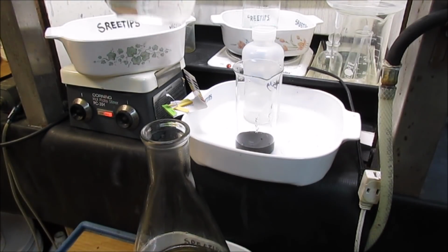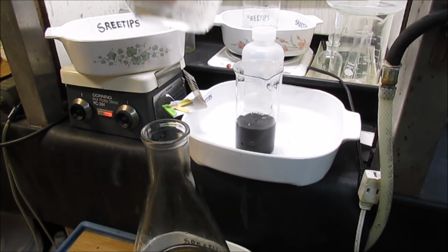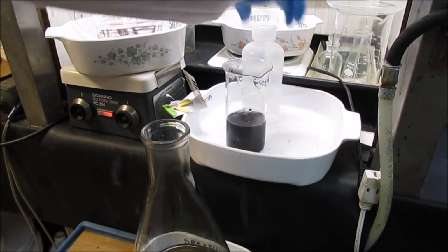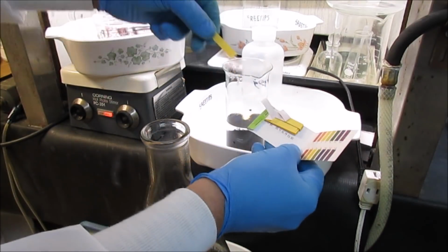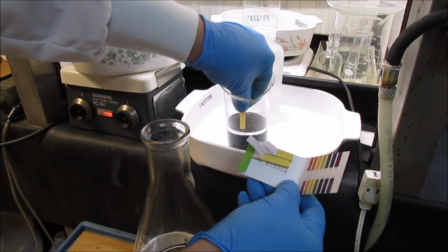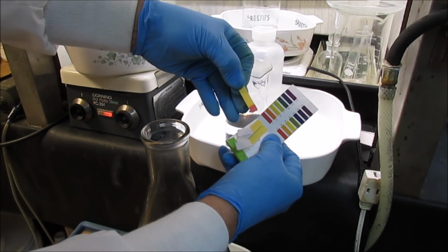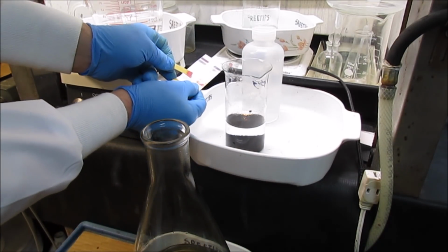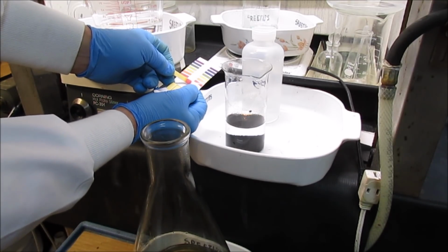This will be about the 5th rinse that I've done with hot distilled water. And what I want to do is just reach in there with a pH test strip, a rough one, and get some kind of idea what the pH is. And it's looking like it's down around 1, maybe 2. So I'm getting the acid out of there, which is what I want to see.